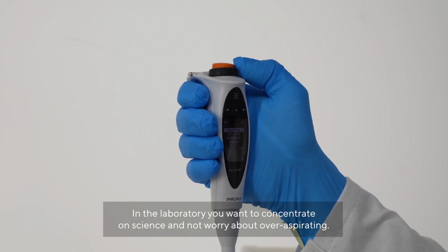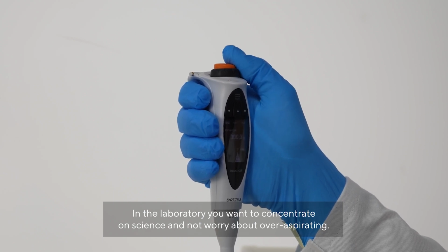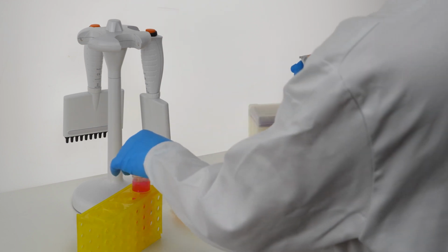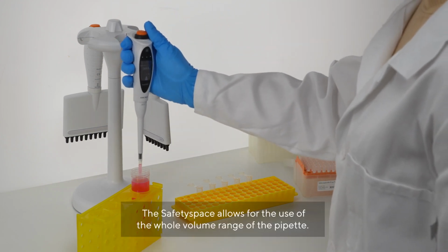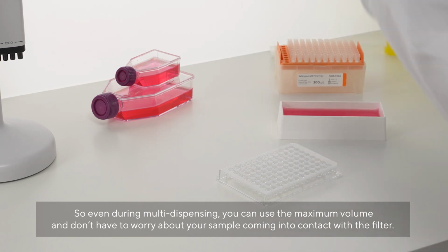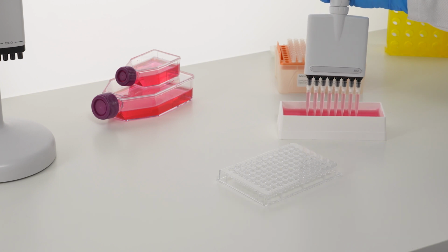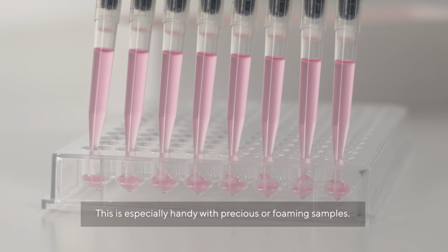In the laboratory you want to concentrate on science and not worry about over-aspirating. Safety Space allows for the use of the whole volume range of the pipette. So even during multi-dispensing, you can use the maximum volume and don't have to worry about your sample coming in contact with the filter. This is especially handy with precious or foaming samples.